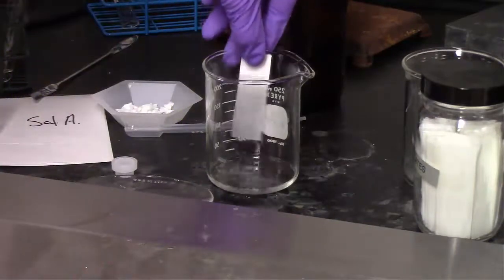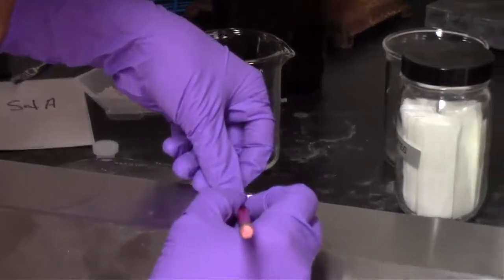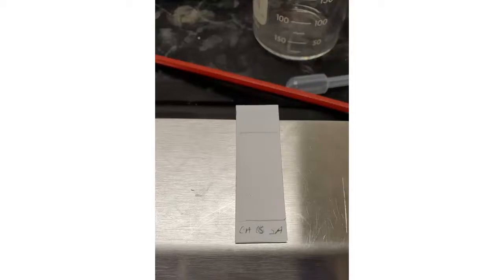We need that because when we calculate RF values, we need to be able to assess the distance the compound ran as well as the distance the solvent ran from the point of the spot to the top of where that solvent ran to. That is what it looked like after it ran without looking under UV light. That is what it looks like under UV light. So there you can see that our caffeine has one spot, our mixture has a spot, which is caffeine and salicylic acid, and our final spot with salicylic acid is just salicylic acid. So we actually did separate the compounds pretty well based on this TLC result.